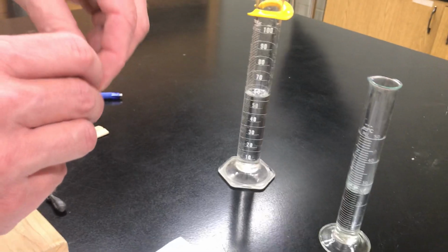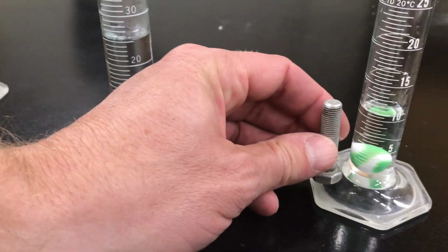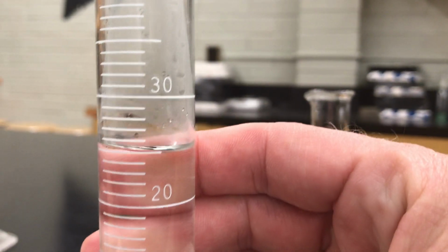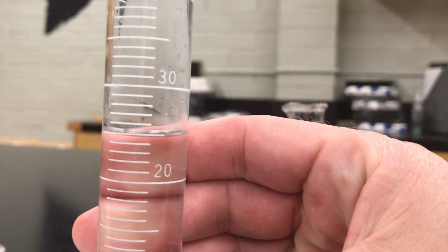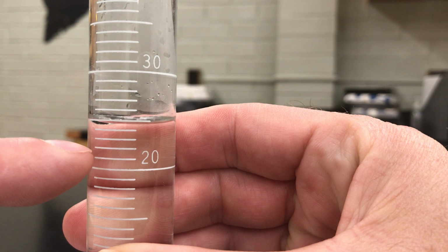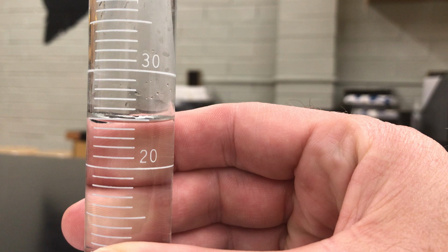Now I'm going to put it into a graduated cylinder. I could have used this small one, but when we started out with only 8 milliliters, the bolt wouldn't be completely submerged. I need something where it's going to be completely underneath the water. I'm getting ahead of myself. I don't want to set that in yet. Let's make sure we get the overall initial volume. Now this has a different scale. 20, 21, 22, 23, 24, 25. So it looks like it's right at about 25 milliliters. Okay? So my initial volume is 25 milliliters. Write that down.